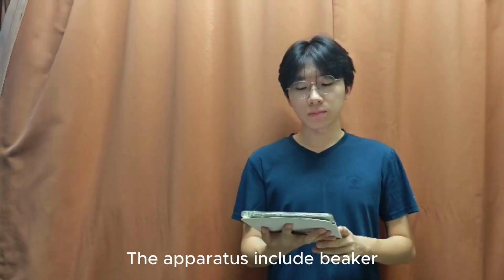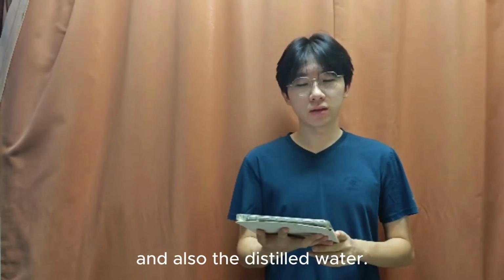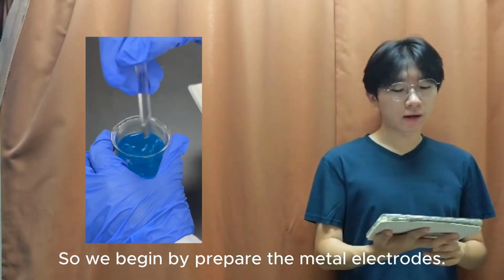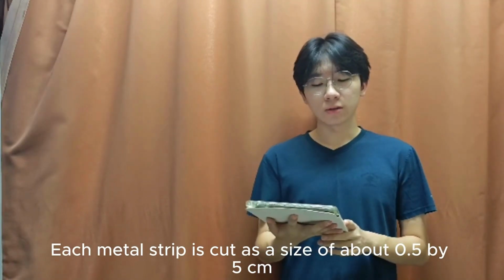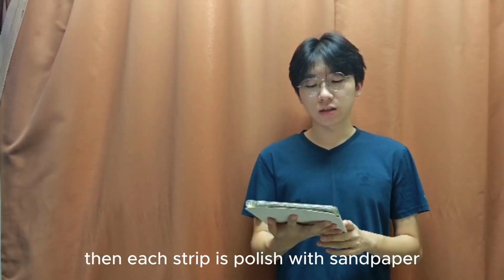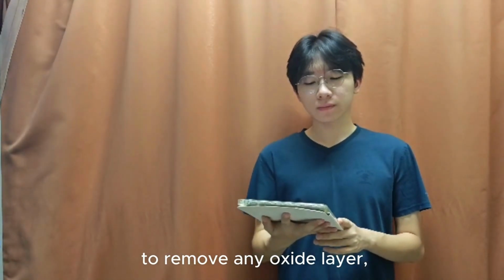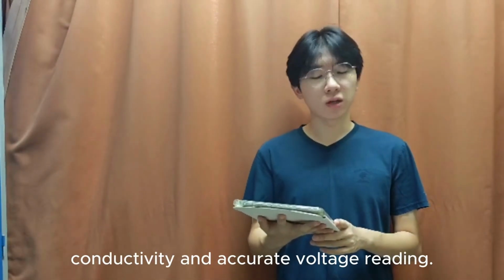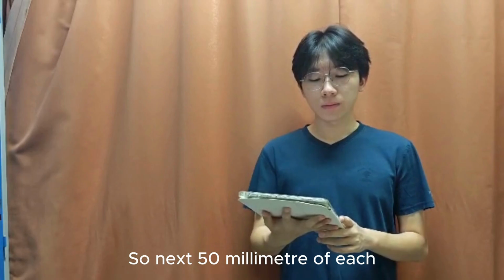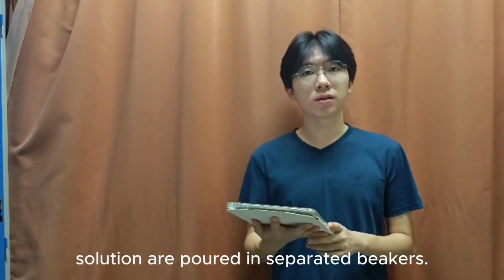The apparatus includes beakers, crocodile clips, filter paper for the salt bridge, and also distilled water. So we begin by preparing the metal strips. Each metal strip is cut at a size of about 0.5 by 5 centimeters. Then each strip is polished with sandpaper to remove any oxide layer, ensuring better conductivity and accurate voltage readings. So next, 50 mL of each 1 molar electrolyte solution is poured into separate beakers.